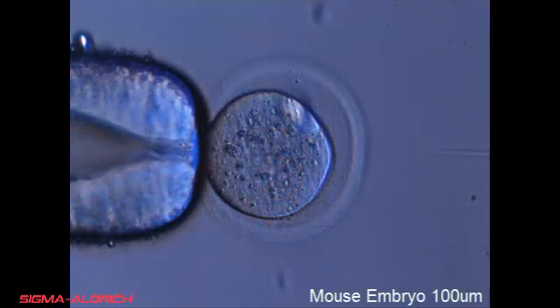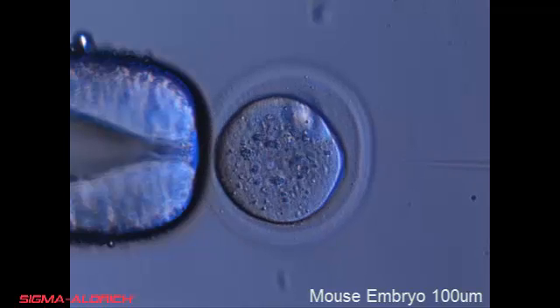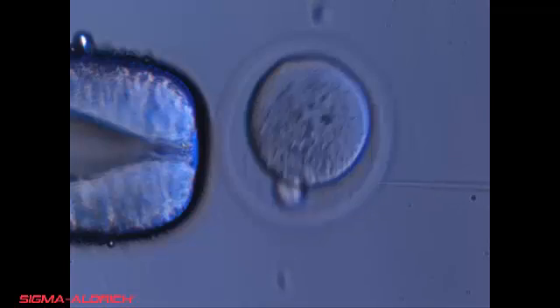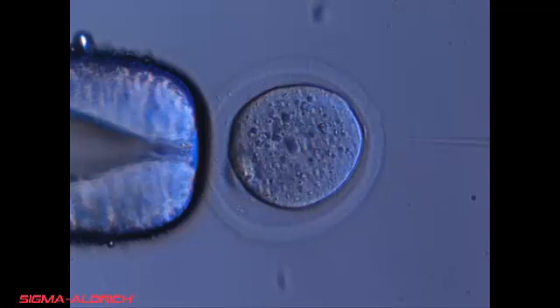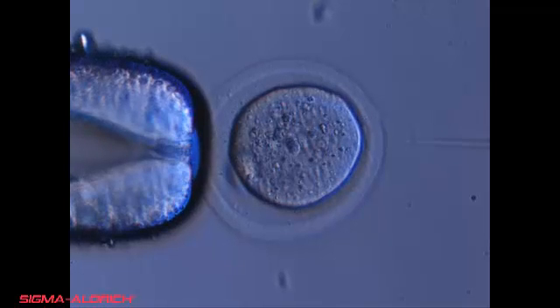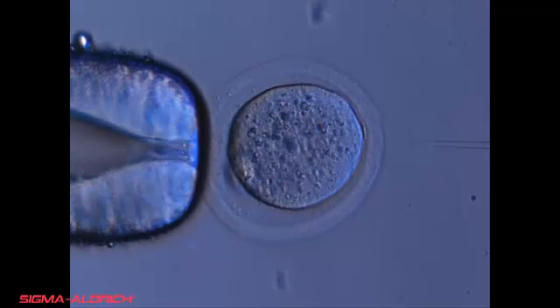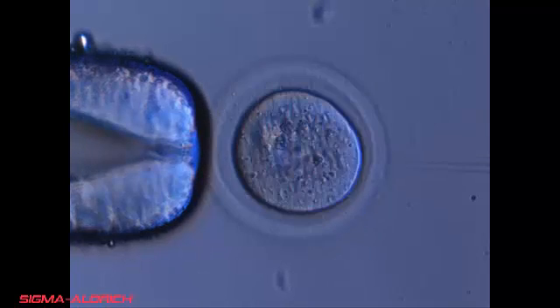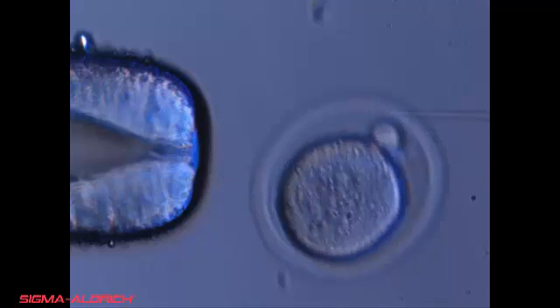Begin the injection procedure by using the microscope coarse focus knobs and pipettes to orient the embryos so the pronucleus is in an accessible position on the right side of the embryo. This is done by expelling pressure out of the holding pipette and applying suction, using the tip of the needle as an anchor. Once the pronucleus is in focus, move the injection needle either up or down to bring the tip of the needle into focus.